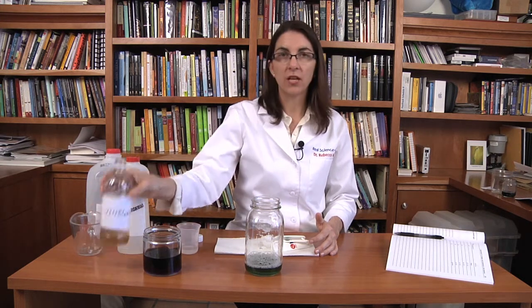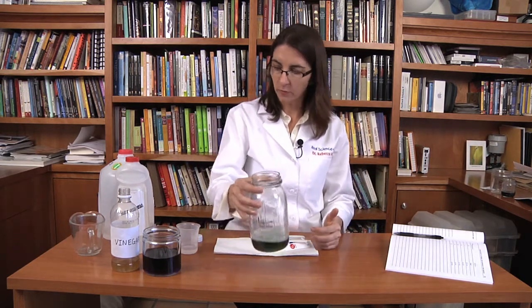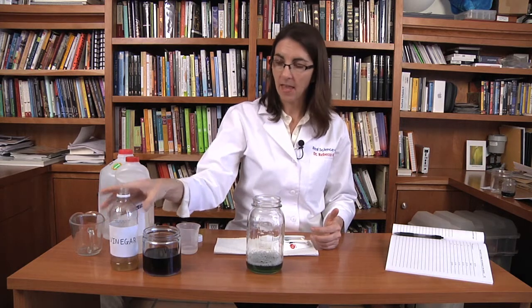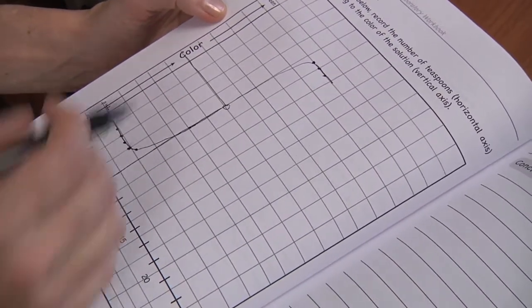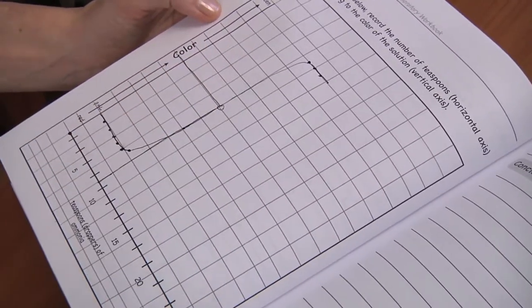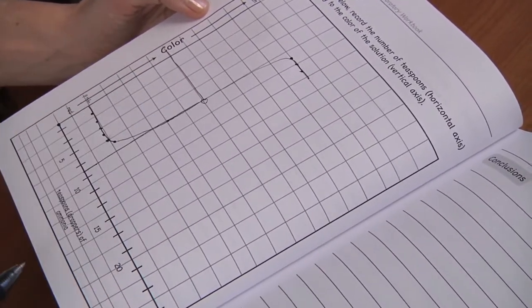So playing with titrations is really a lot of fun. You can change the concentration of either your ammonia or your vinegar by adding distilled water to either of them, and then you can lengthen out the titration — use more dilute ammonia or more dilute vinegar — and really watch each step of the reaction. It's useful to do a titration because you can get additional information about the reaction, you can plot the data, take a look at how the reaction went, and even calculate the endpoint — when did the reaction complete? So it was really fun to do an acid-base titration. It's interesting when we can use the red cabbage indicator to watch an acid-base reaction actually occurring.